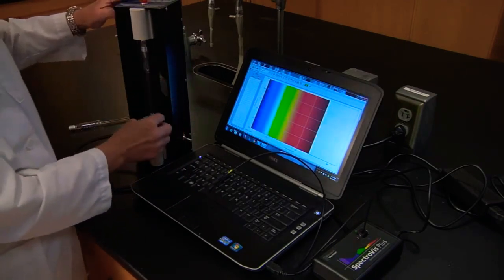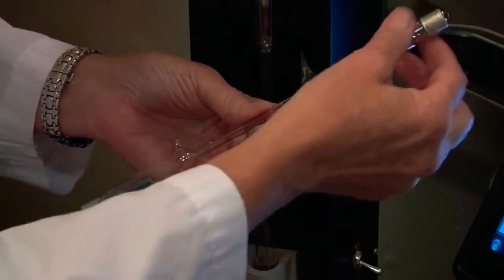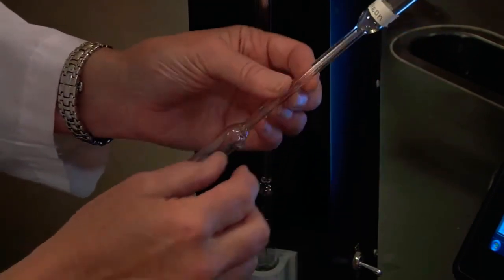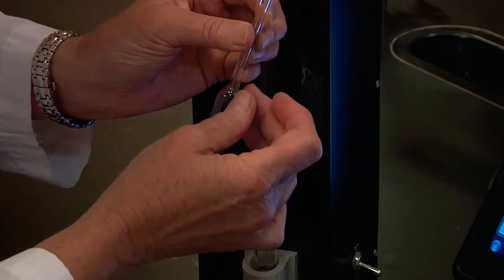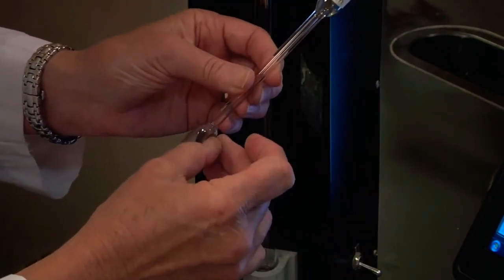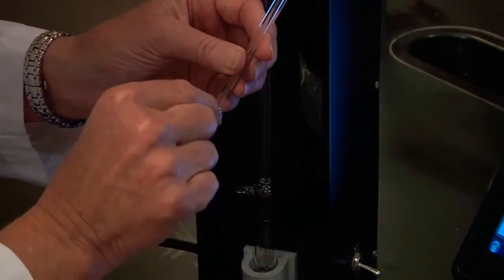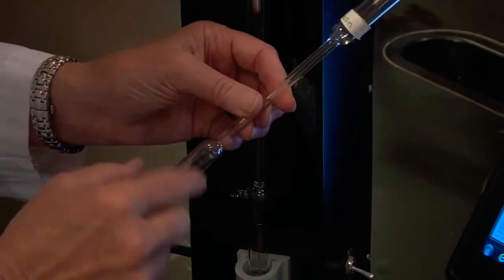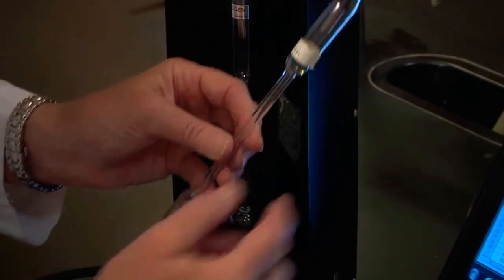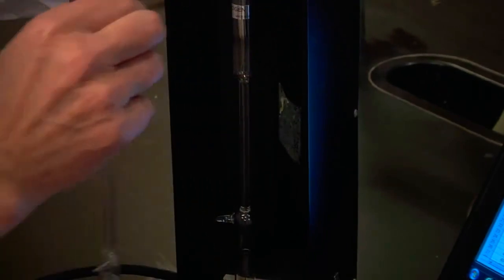What we have in this tube is a gas discharge tube. The way these are made is you pull, using this right here, you pull off all of the gases that are in there and inject just a small amount of the gas you want to test, and then melt that. So we have a low pressure inside, we have an electrode here, an electrode here, and we're going to put this in our high voltage power supply.